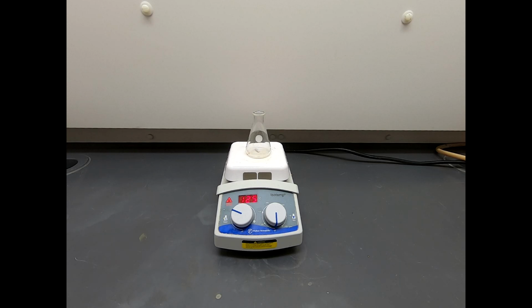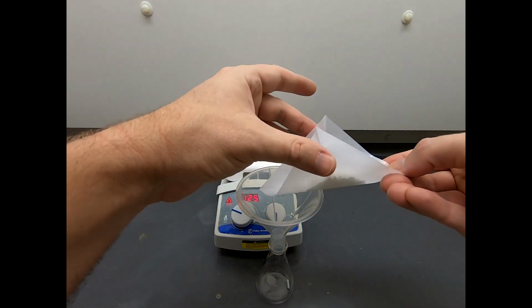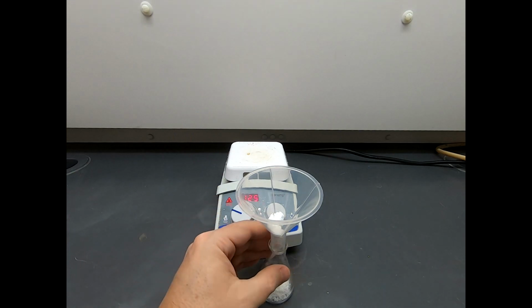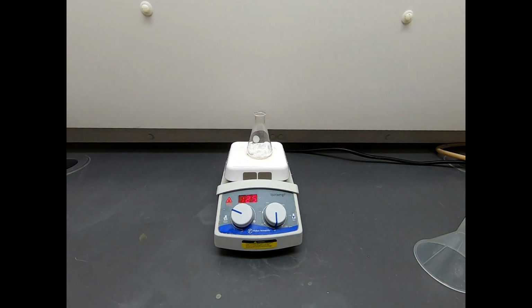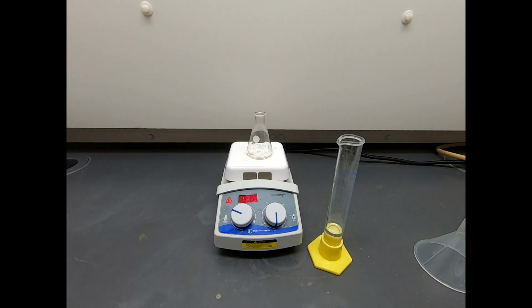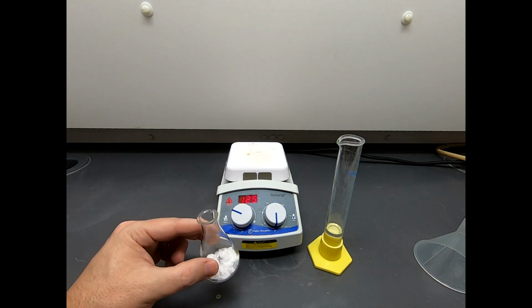And into this 50 milliliter Erlenmeyer flask, we are going to add our freshly weighed out benzoin. And I'm going to use a powder funnel because that's a lot of stuff to fit into that little opening. I think that's pretty good. What else we're going to mix in is 15 milliliters of concentrated nitric acid. Concentrated nitric acid is 70% nitric acid. It's really quite potent stuff. So if you get this on your hands, of course you want to get it off your hands quickly. Many people would say you absolutely must wear gloves.